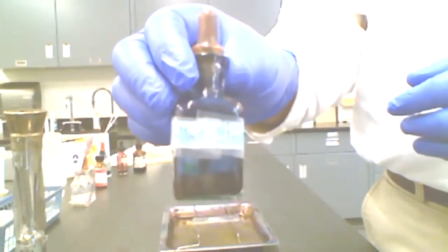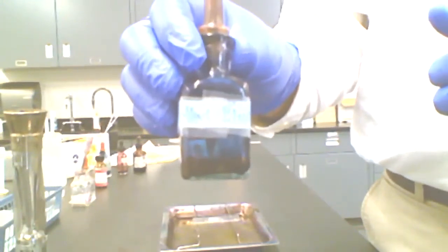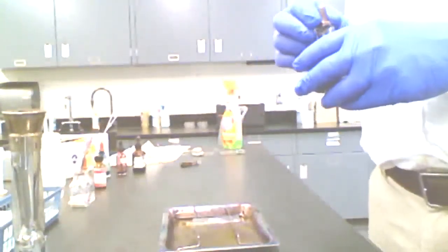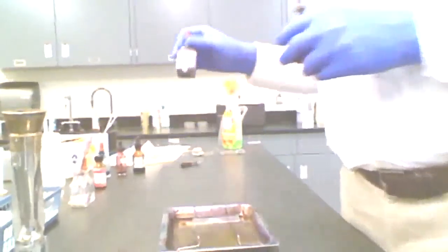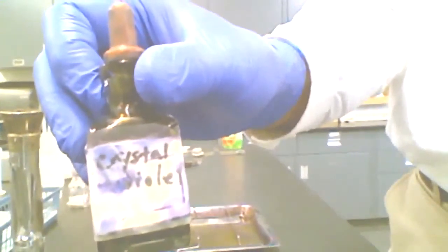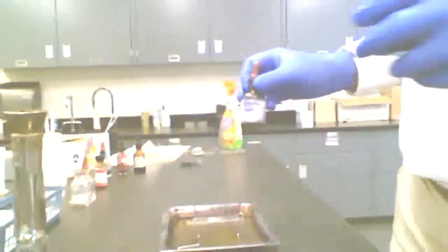Notice the spelling on that, methyl, METHYL, ENE, methylene blue, very common reagent used in simple staining. Another one that we use sometimes is called crystal violet. We'll use that extensively later. That's important in the gram stain procedure. I could use that one now if I wanted to, but I'm going with the methylene blue.